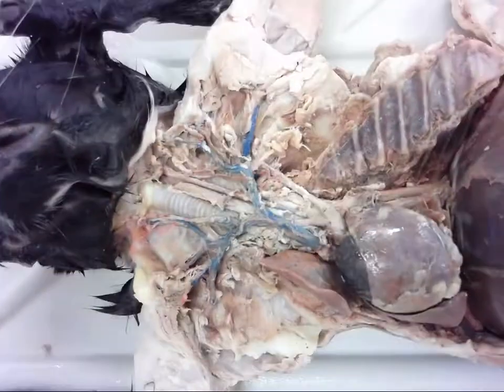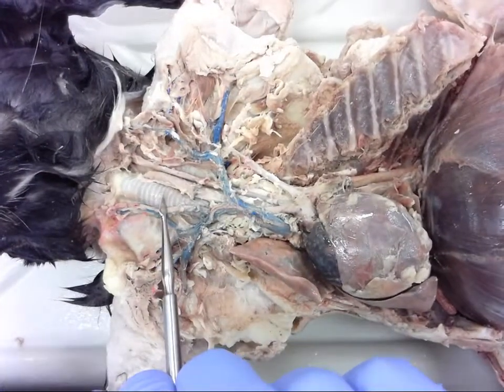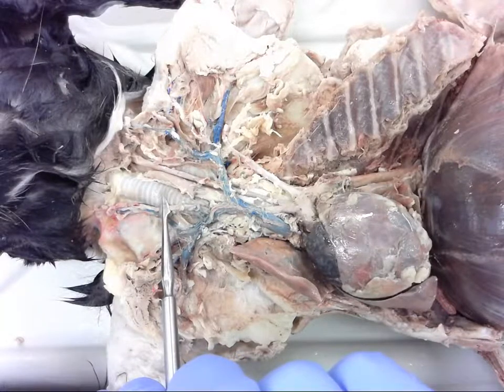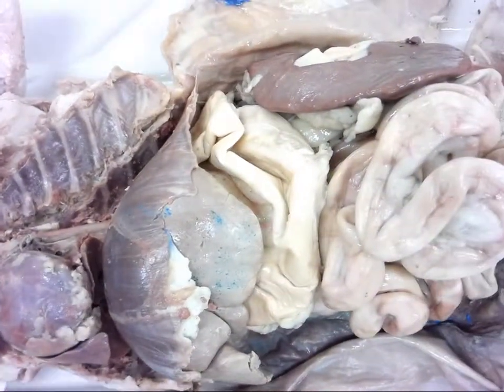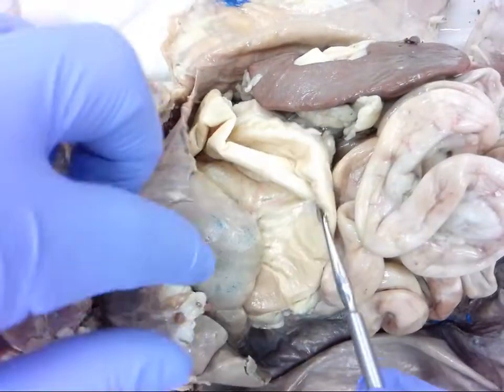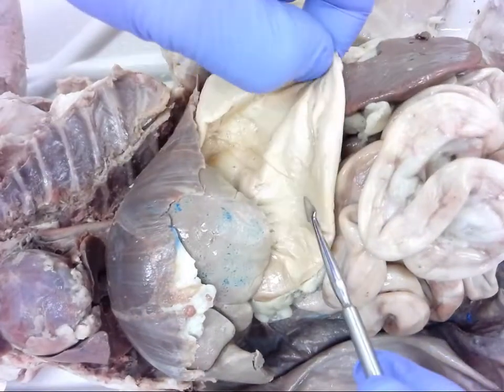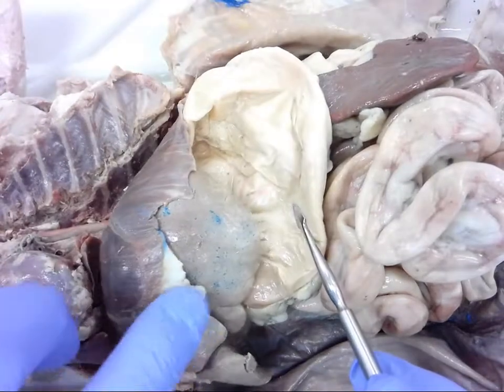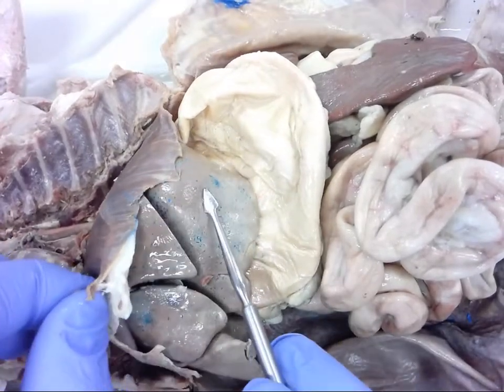Number one is this. Number two — scroll down to this. Number three, right above number two, is here.